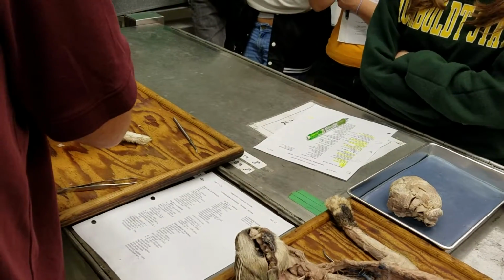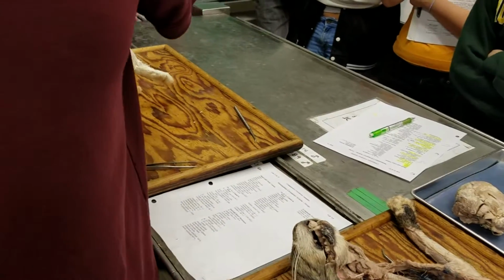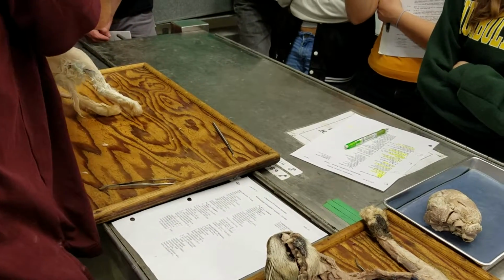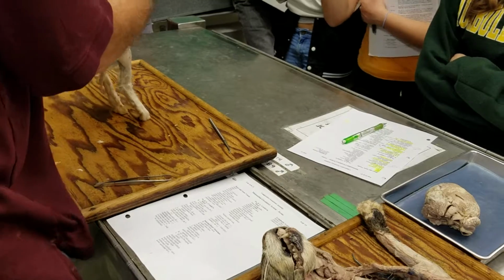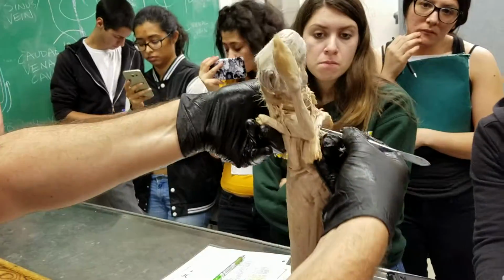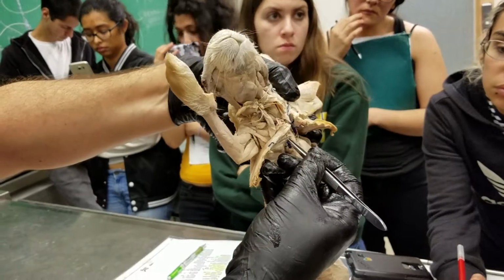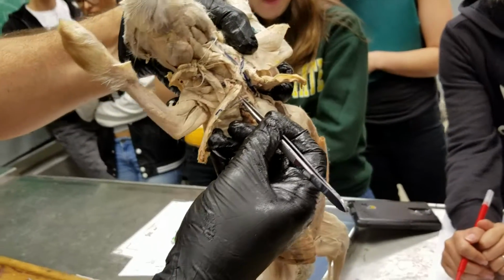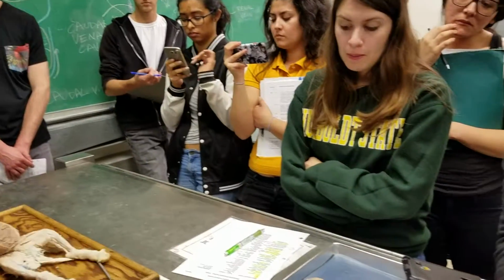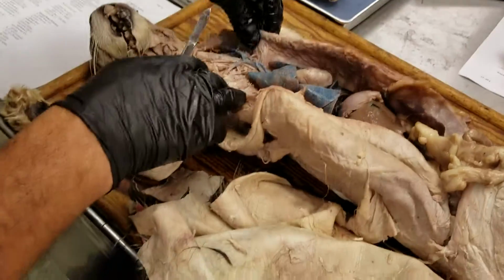And so that would be basically right in here in the rabbit, and you're not going to really be able to see it except sort of the general region, but that would be it in there. Okay. So sort of generally where it would be. And then in the cat, I'm not 100% sure.